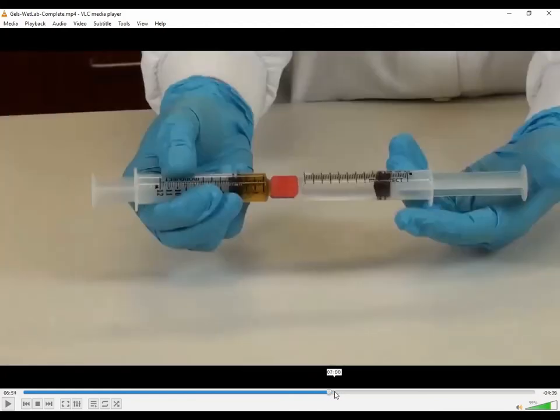So now you have 2 10 ml syringes. You can transfer the solutions back and forth without creating a volcano because you have equal size syringes. So now this is how you're going to make your emulsion. You need to do this with energy and vigor. You need to squish back and forth, and you're going to need to do it at least 40 times. So let's watch her do this here.